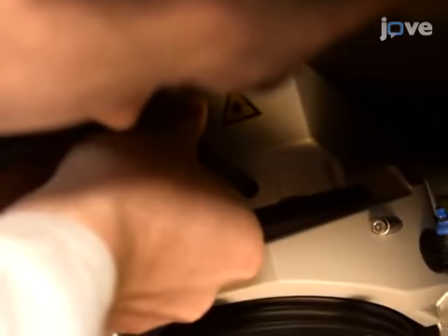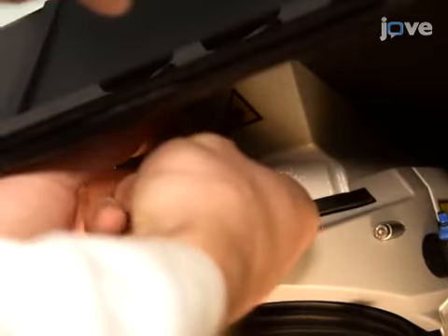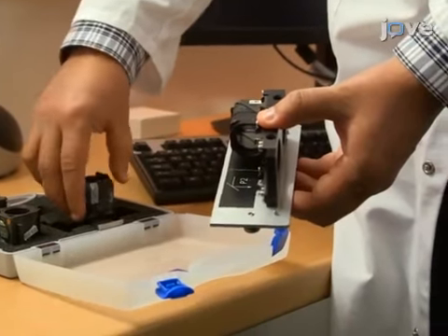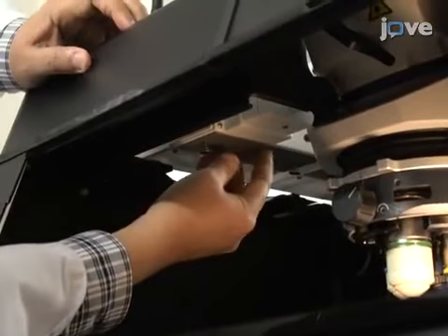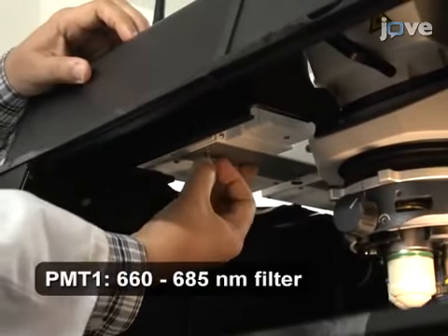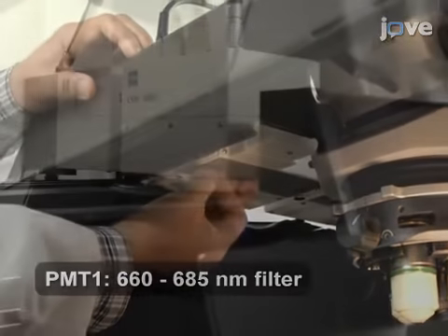Set the narrow bandpass filter in the reflector cube in front of PMT1 to record only the CARS signal at 670 nanometers to reproduce the presented results.